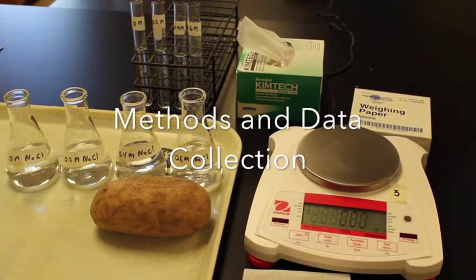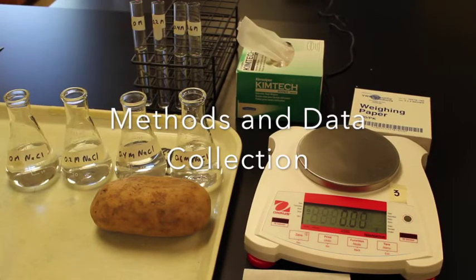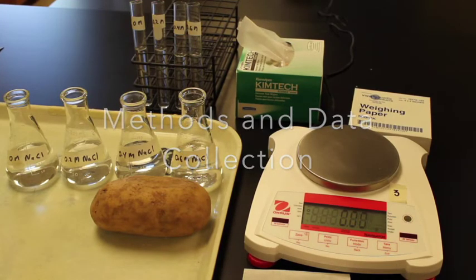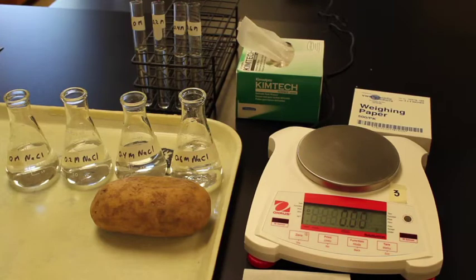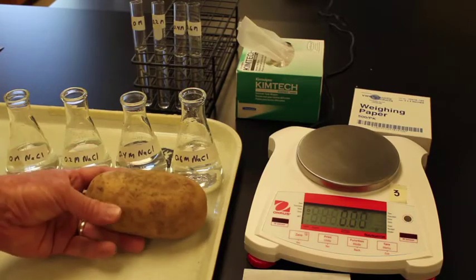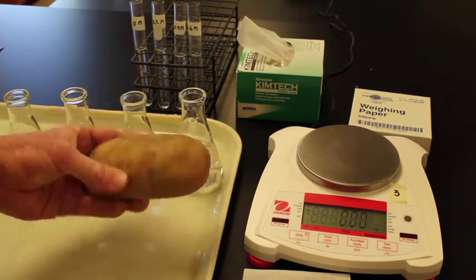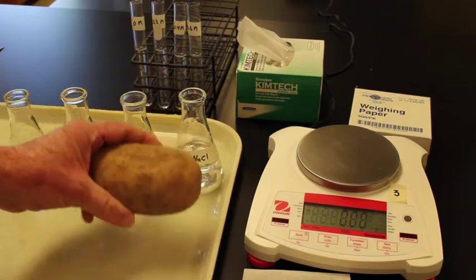Aquaporins are components of cell membranes used to transport water. In this lab, you will investigate whether aquaporins function passively through facilitated diffusion or actively with the input of energy by active transport. To examine this question, we will use a potato. This is a normal russet potato from the store. I just purchased this from the store.